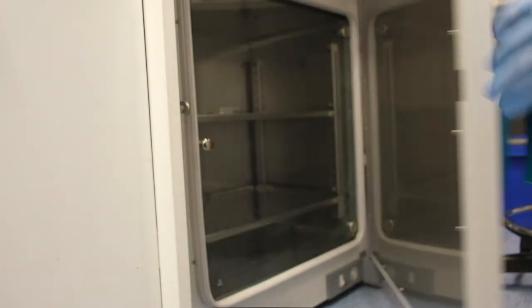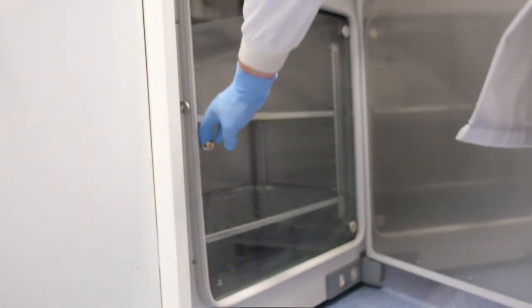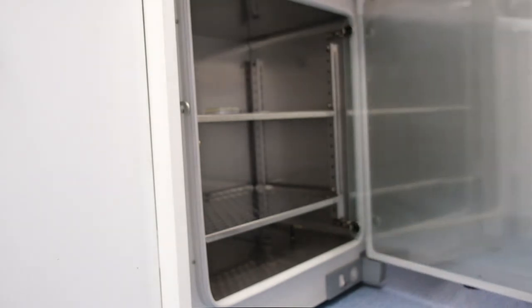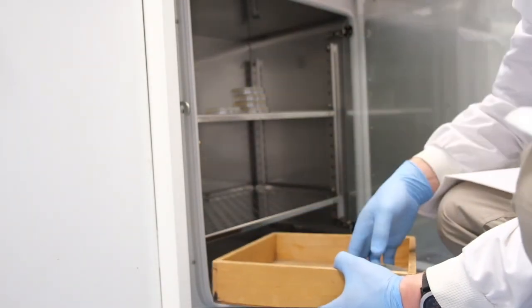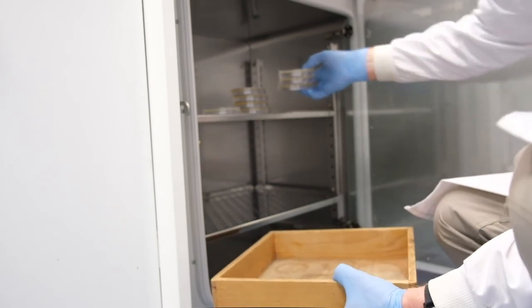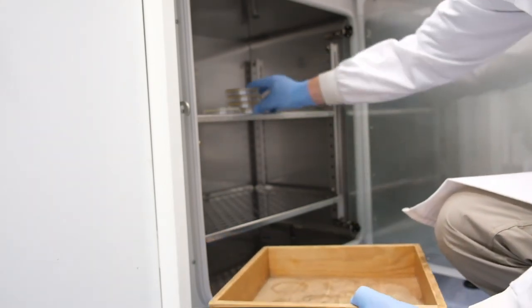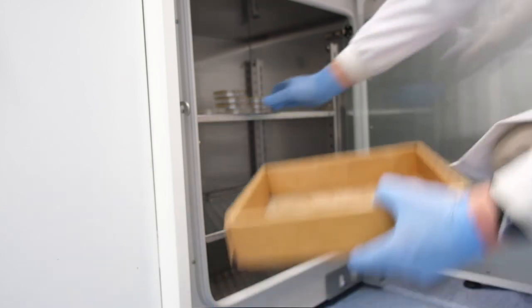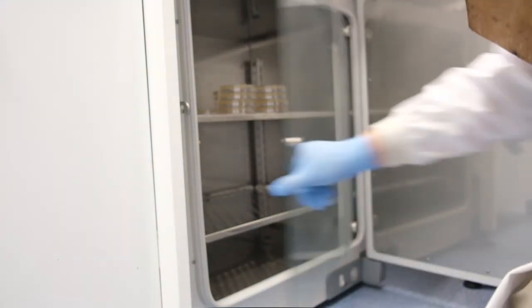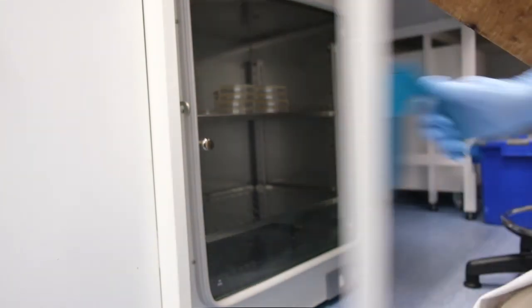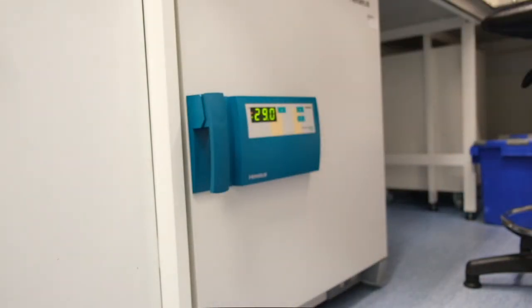Plates are collected and taken to the incubator. Here they will be incubated at 30 degrees for up to seven days. Plates are placed in the incubator, lid side down, agar side up. The incubator is closed and will soon return to 30 degrees centigrade.